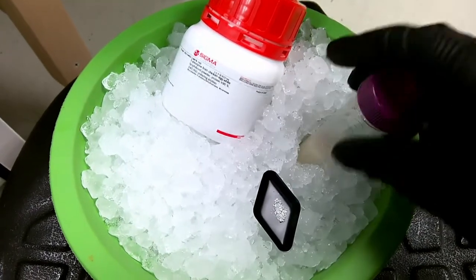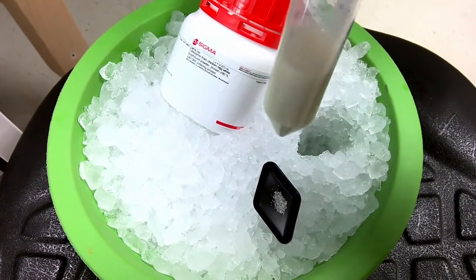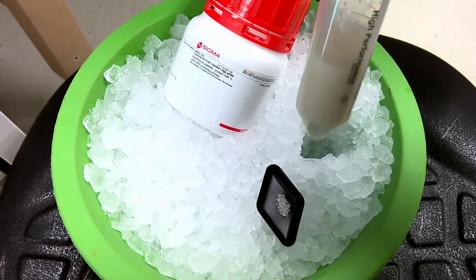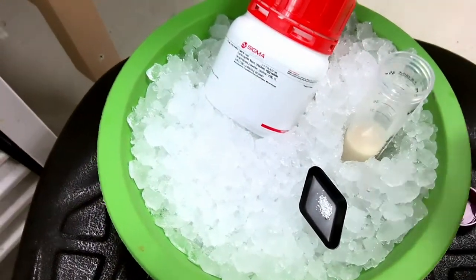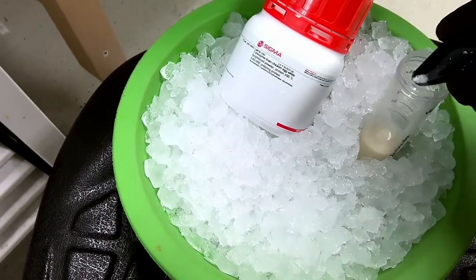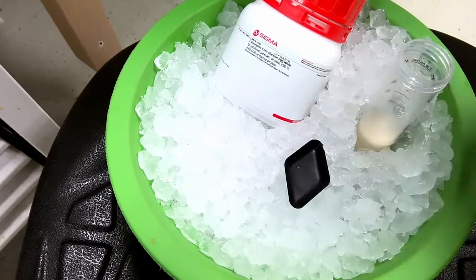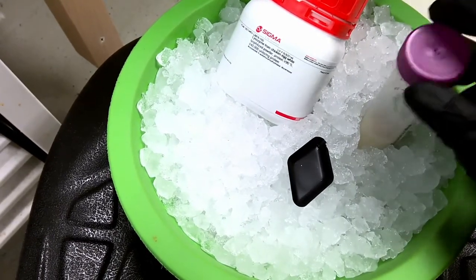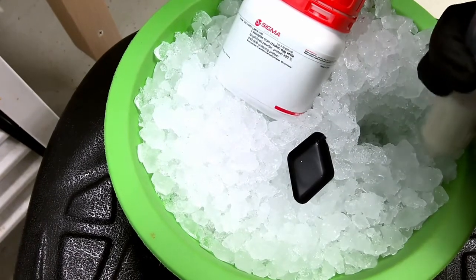Alright, so I finally finished resuspending the cells, and here you can see we collected about 20 mLs of cells in total. So the next step is I'm going to add about 20 milligrams of lysozyme. Lysozyme is an enzyme that specifically degrades the peptidoglycan layer in E. coli cells.